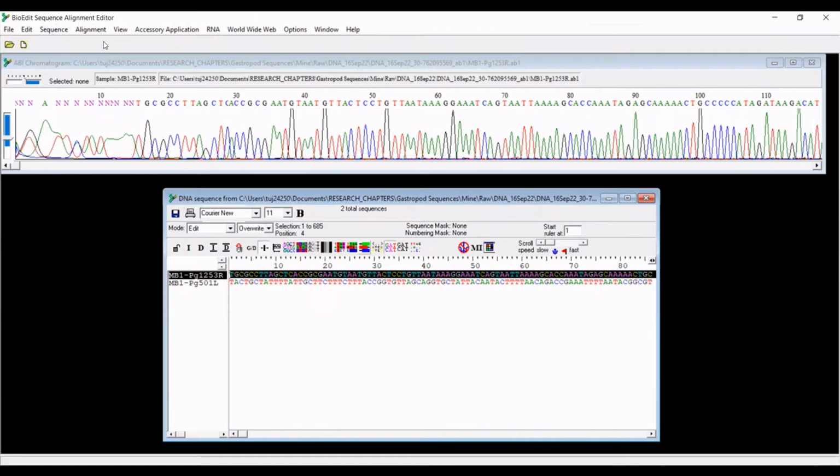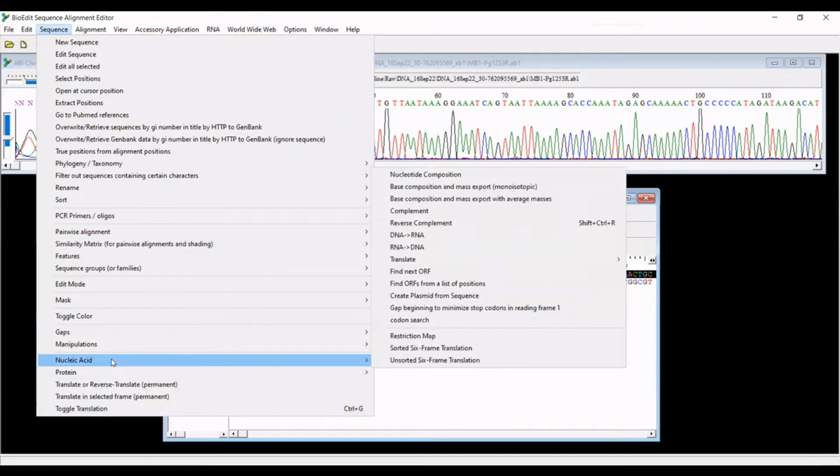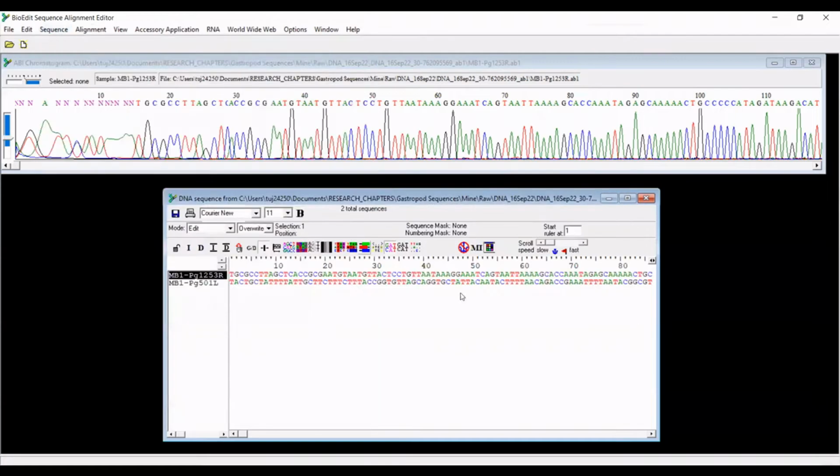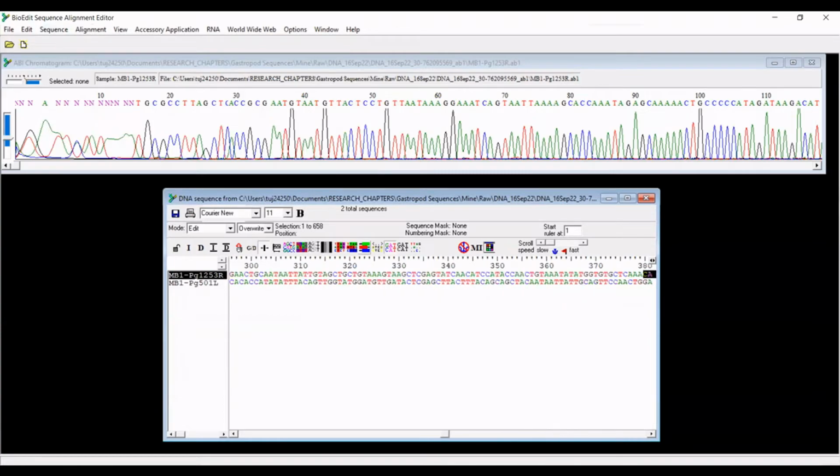And you can do that using the sequence options up here. You can go to nucleic acid and hit reverse complement, but you can also see here that there's a shortcut embedded within the program. If you, oops, sorry. If you select, so you want to verify that you've selected the entire sequence, which we have. If you hit Shift Control R, you can see that that has reverse complemented the sequence. So if I hit undo, redo, undo, redo. Okay, so this is reverse complemented now.